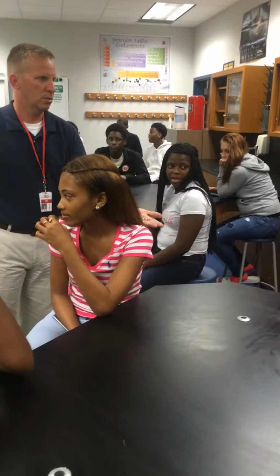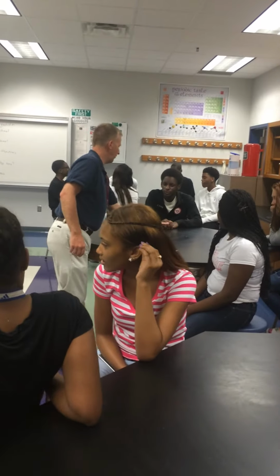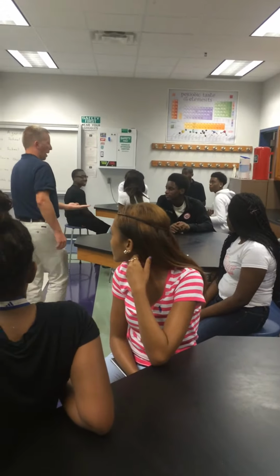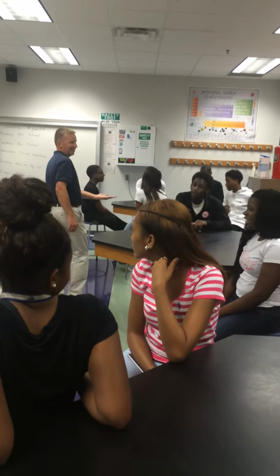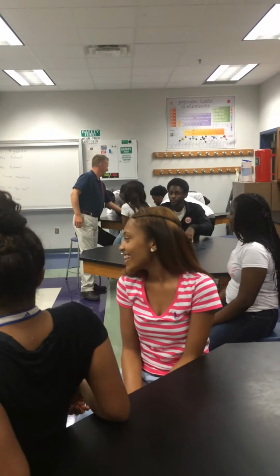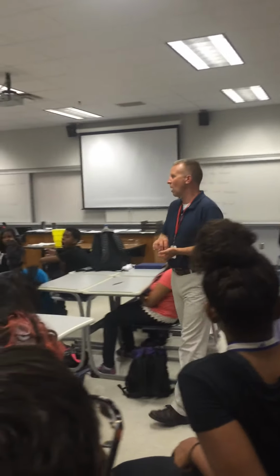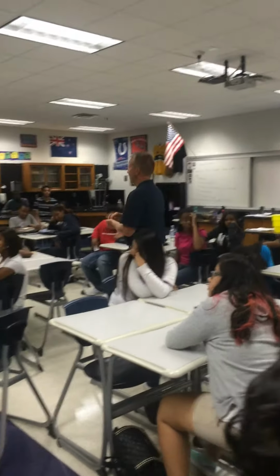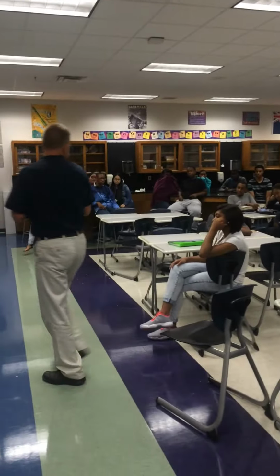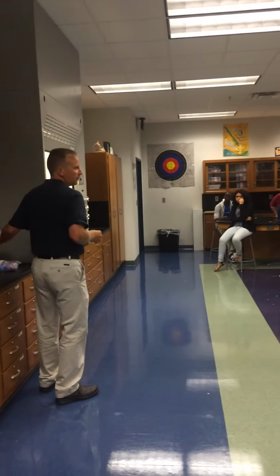You want to touch it? Touch it. Okay? What if you swallow that? It would probably hurt coming out. So no, you do not want to swallow this. You don't want to try to eat it because it might make you just a little bit on the sick side. Now, what we're going to do is we're going to put the zinc into a balloon.